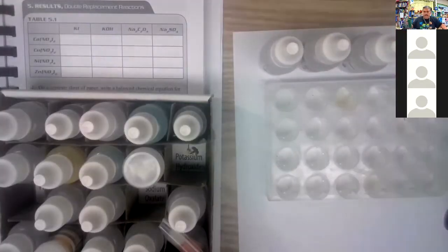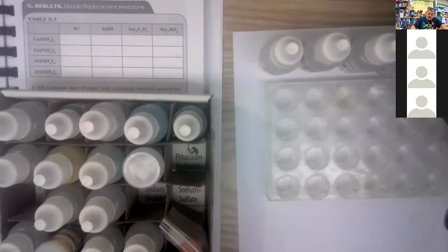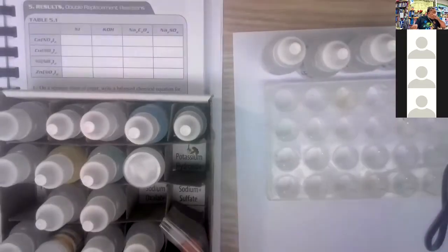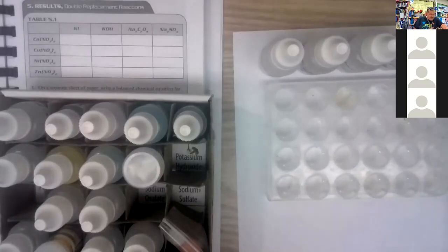And then the last one is sodium sulfate. And sodium sulfate is in the third row and the fifth over. So those are our 4 chemicals. Remember, these are dropping bottles, so you don't want to touch the plastic part of the dropping bottle to anything. So you're going to let the chemicals drop out of there. All right, that's why it's called a dropping bottle, right? Okay, so let's do the sides now.